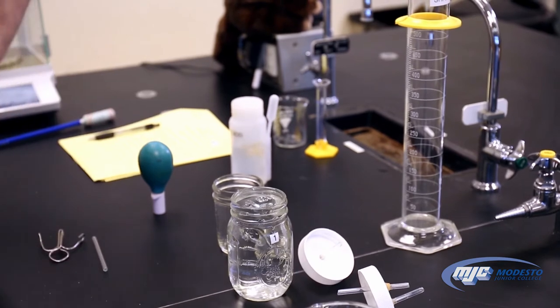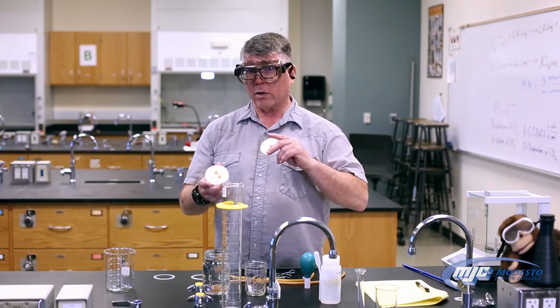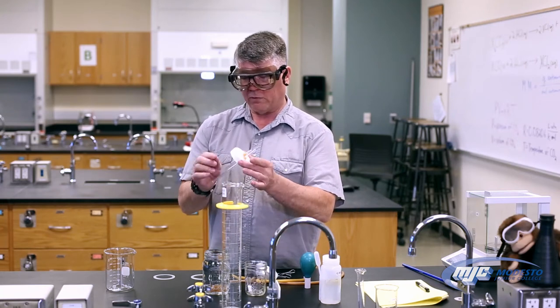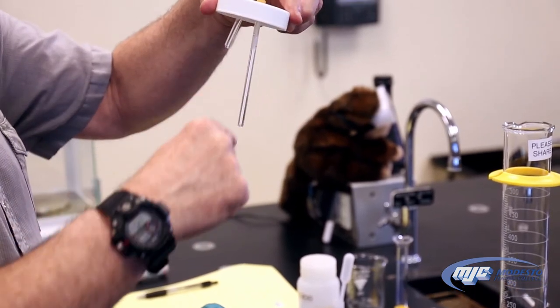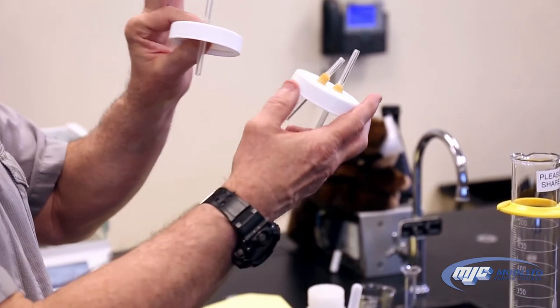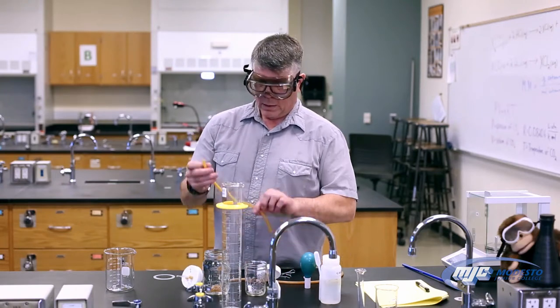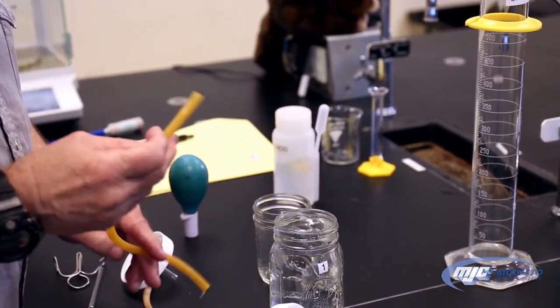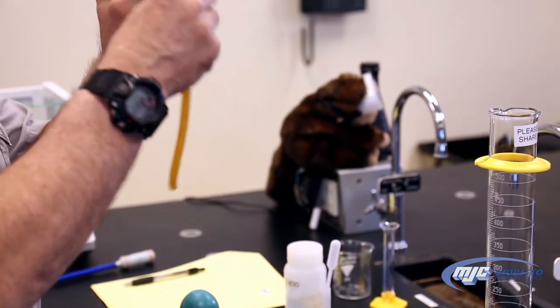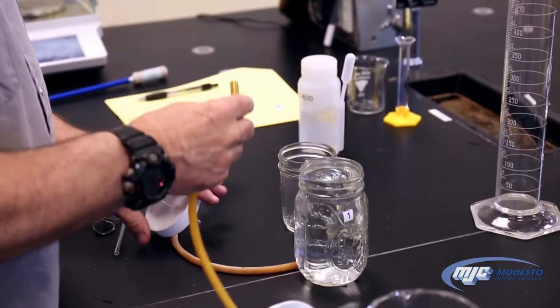Now we're going to connect the rubber tubing. Here's one place you can go wrong. The lid for the quart-sized mason jar has two pieces of glass tubing — one does not go down as far as the other. We want to connect the short one to the other lid; think of it as 'short to short.' Take a piece of rubber tubing — it helps to dip the ends in water so it goes on more easily — and pop it onto the short piece of glass tubing on the quart jar lid.